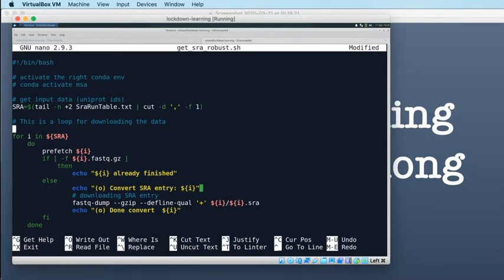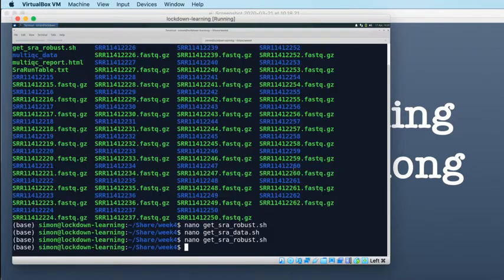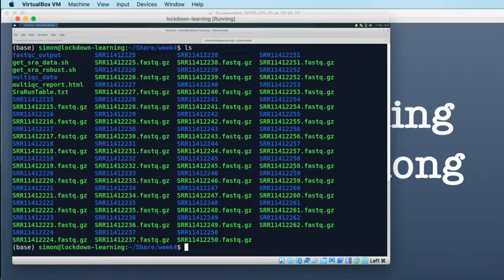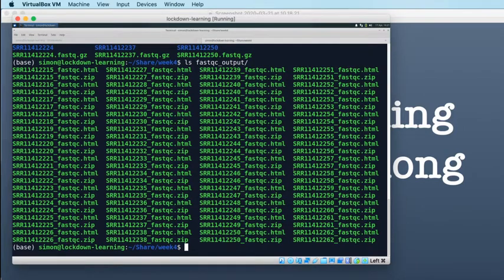on to talk about FastQC, which is what I said we were going to talk about today. So that's what we'll do now. If you remember yesterday, we ran FastQC. I left the session at the end of the session. I was running FastQC over my 48 FastQ files that I had managed to download, whether correct or incorrect, and we'll come back to that another time. But I left FastQC running over those files, and there you go.